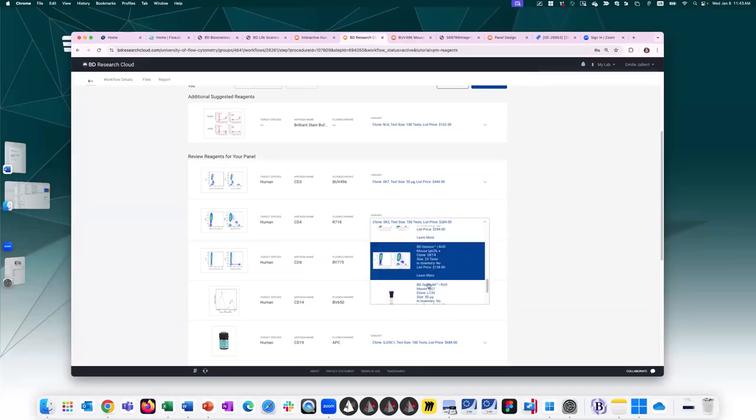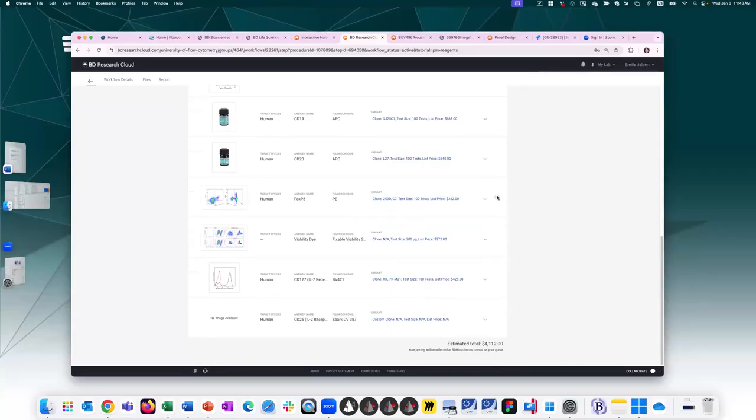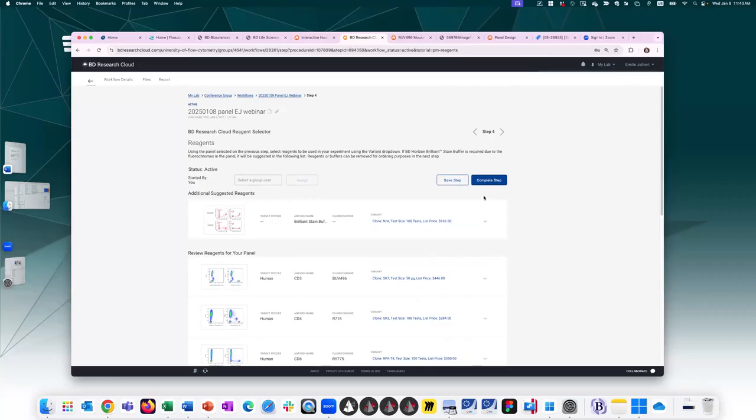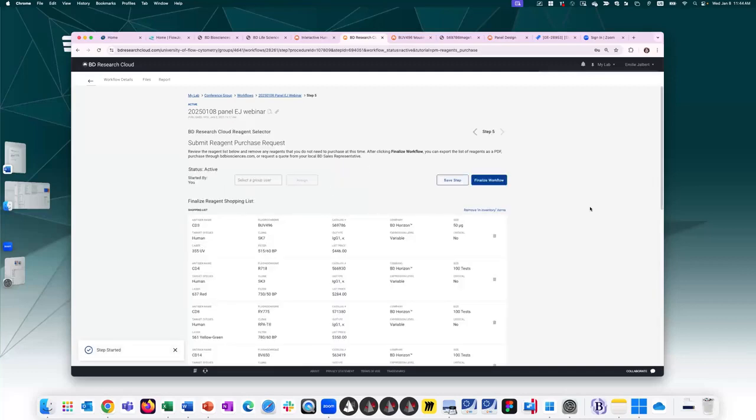So you just have to scroll through and decide which one is best for your needs. We also list the list price, so just the default price. It won't reflect your pricing per se, but it'll give you relative pricing information. And so you just go through the list. If I already have it, I still get that little check mark saying you have this in the lab. And it gives you an estimated total cost for your panel given the selections here. Again, that you could have assigned it to someone else in your lab.